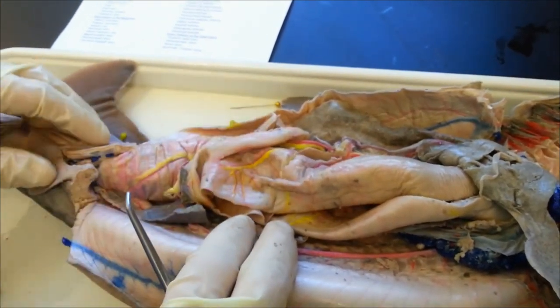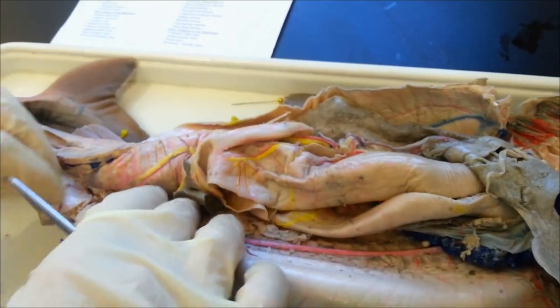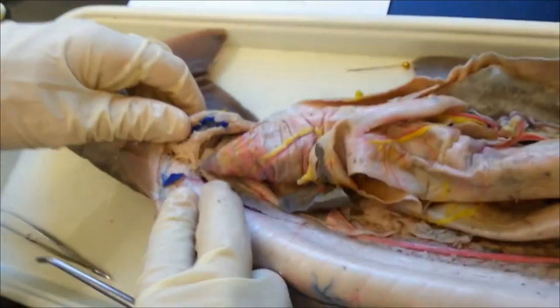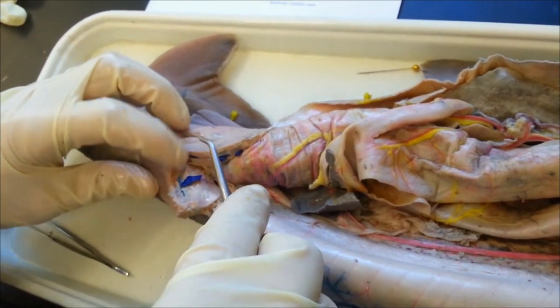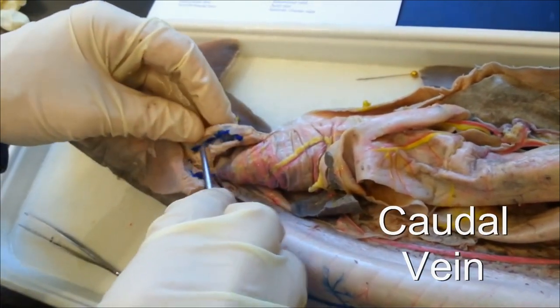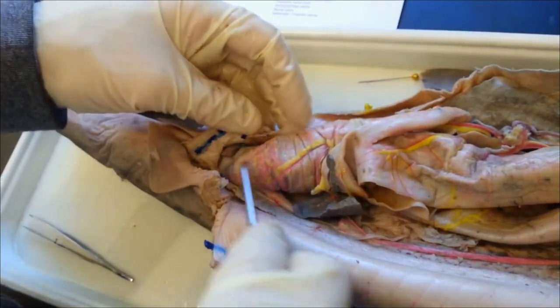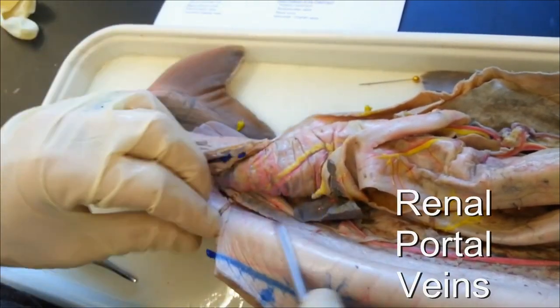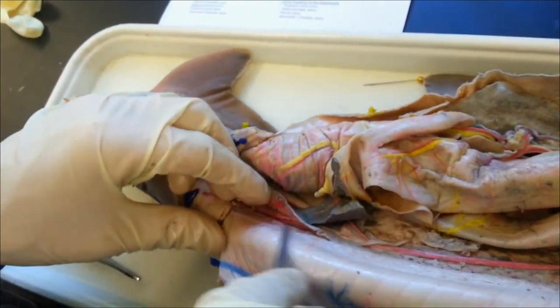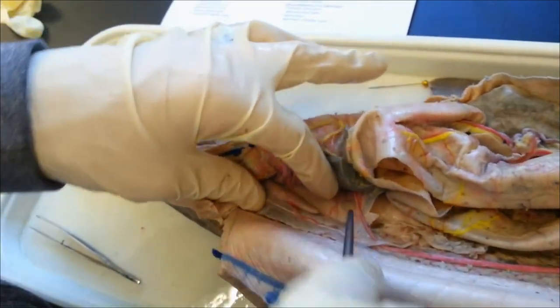The renal portal system — for some reason the latex didn't get injected very well — but what you have is the caudal vein, which is in the tail, and then that splits into the renal portal veins, which go then into the kidneys. You can't see them because they didn't get latex.